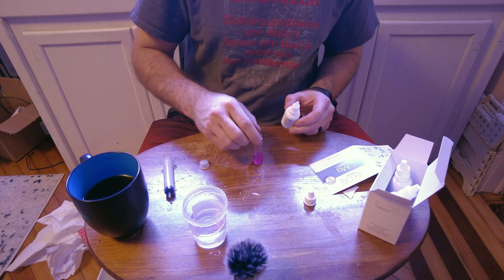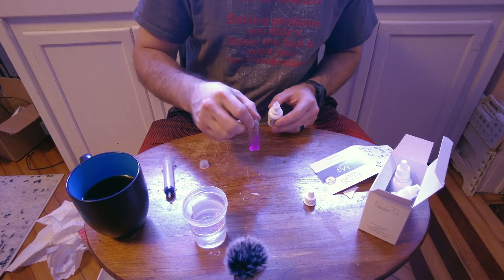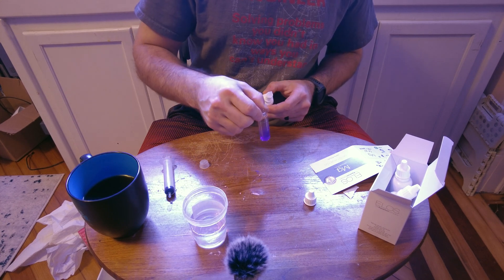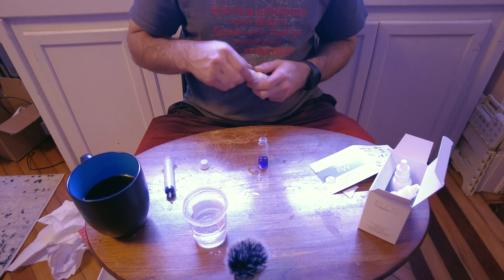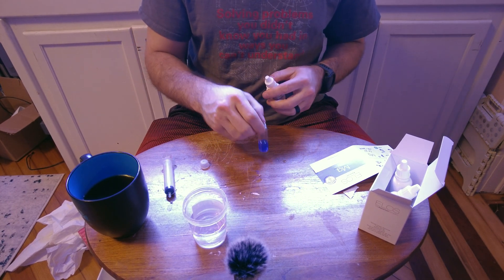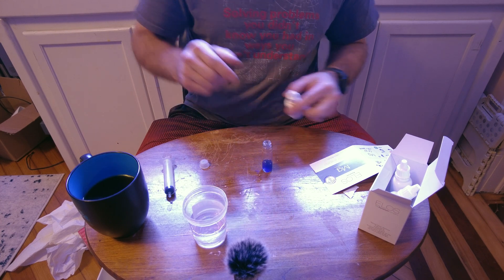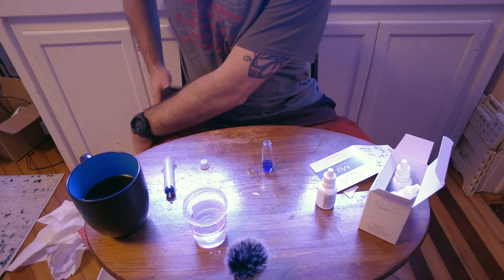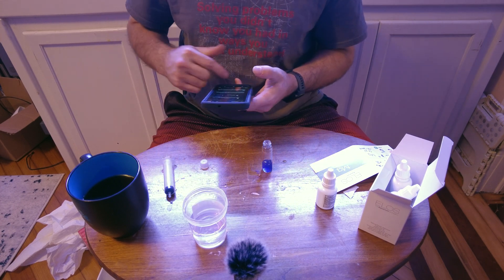This one should be less than 10 drops depending on my magnesium. Adding drop-wise: one... and now at five it turns blue. We're going to make sure that stays for 30 seconds. So we've got five drops. What was our first number, Kayla? 31.